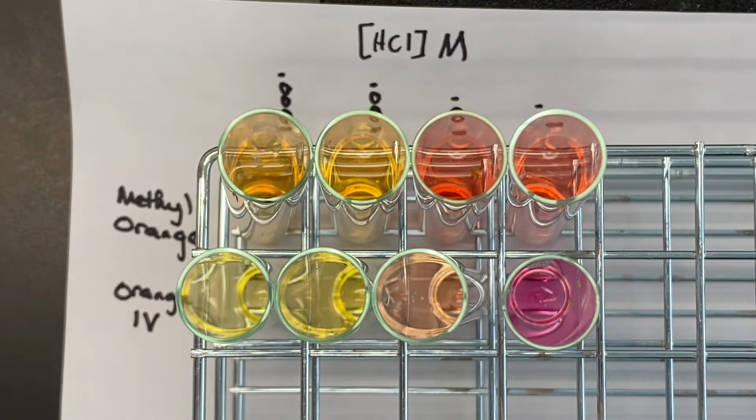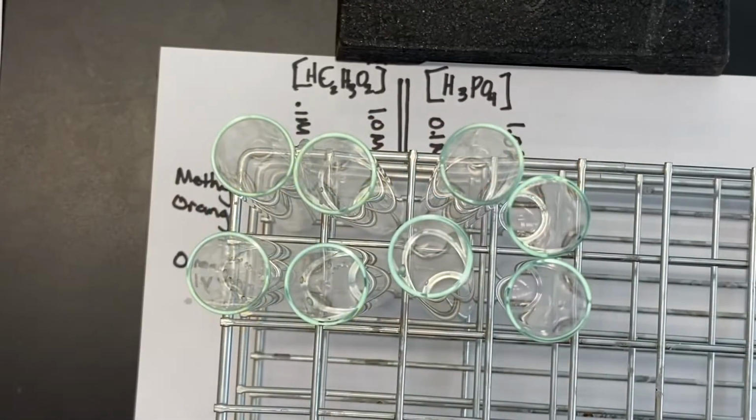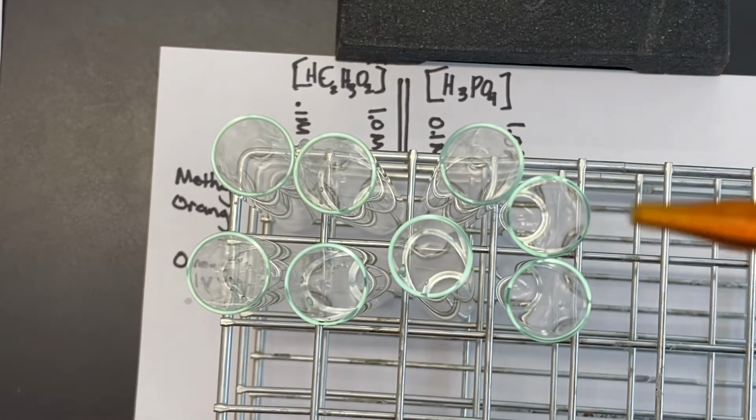So the idea is to use the colors from part 1 in order to figure out what the H+ concentration is in part 2. So we'll pause the video and we will restart it when we have the second set up for you. So we are now ready for part 2. All of the weak acids are in the test tubes, and Miranda is going to add the 2 indicators just like for part 1. Wait, this methyl orange.